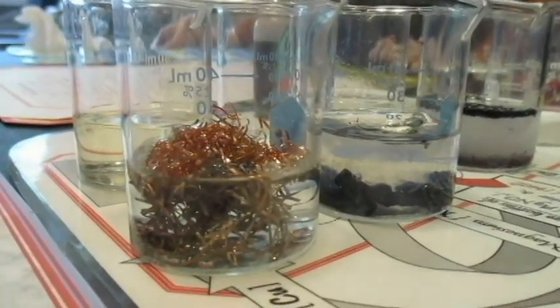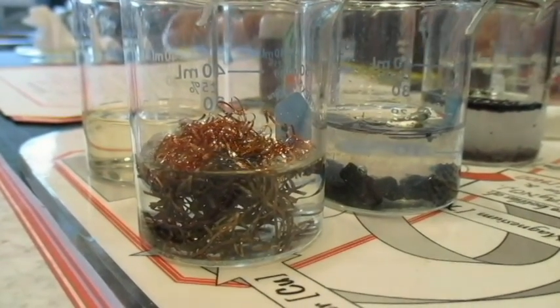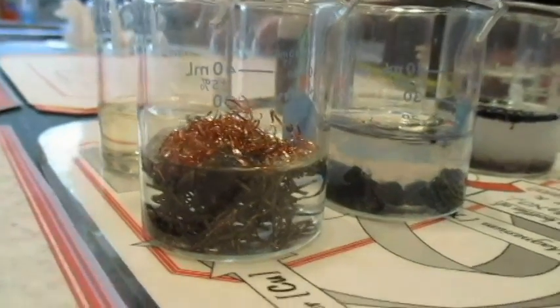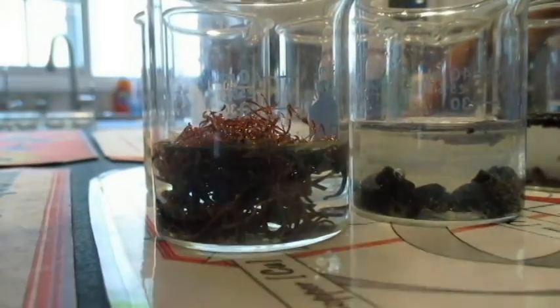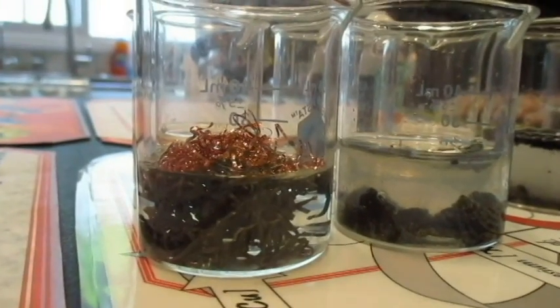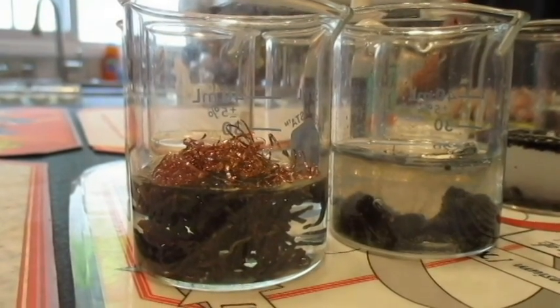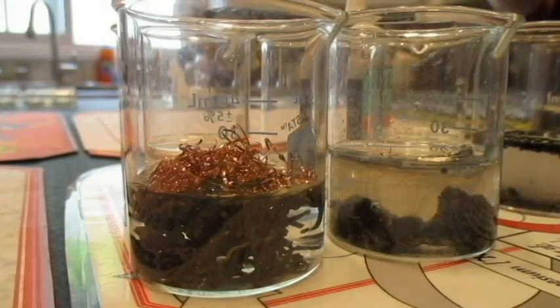So do we see any signs of a chemical reaction? Any signs of change? Not yet. This one's fizzing very slightly though. Don't you notice any sort of color changes? This one's the copper and this one is the magnesium. Yeah, on the copper it's getting darker. Darker, right? Yeah, but the other one is just normal. Well, let's see if there's a change of temperature. Lucy, see if there's a change of temperature in the copper one.